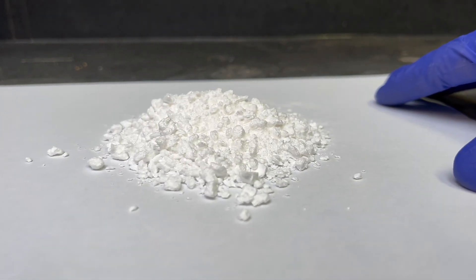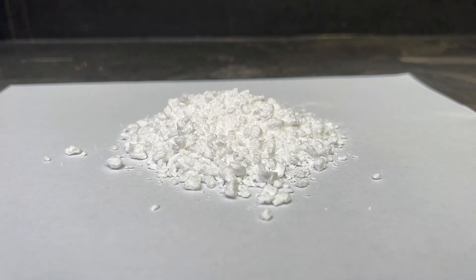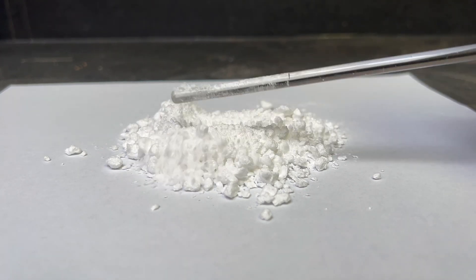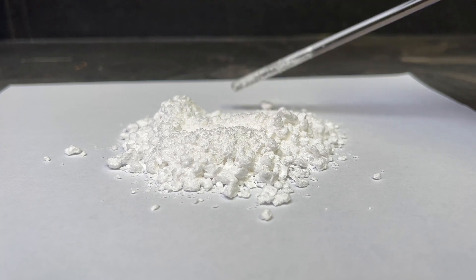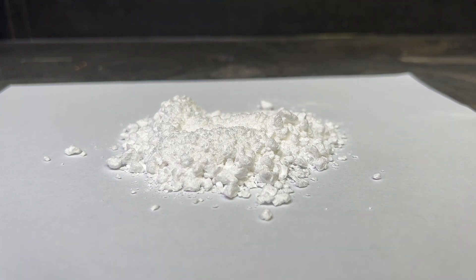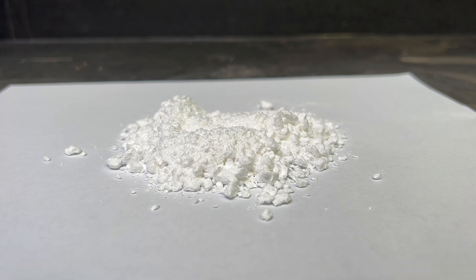One method of production of benzoic acid is by oxidizing toluene. The way toluene is oxidized involves using potassium permanganate. Potassium permanganate is a powerful oxidizing agent and is commonly used in organic chemistry.